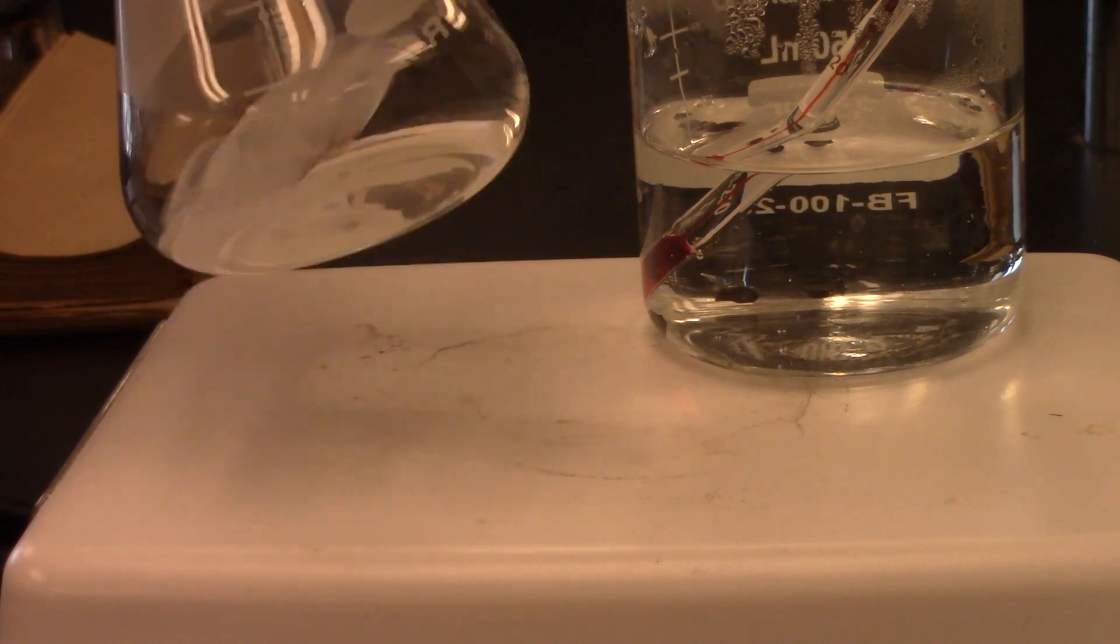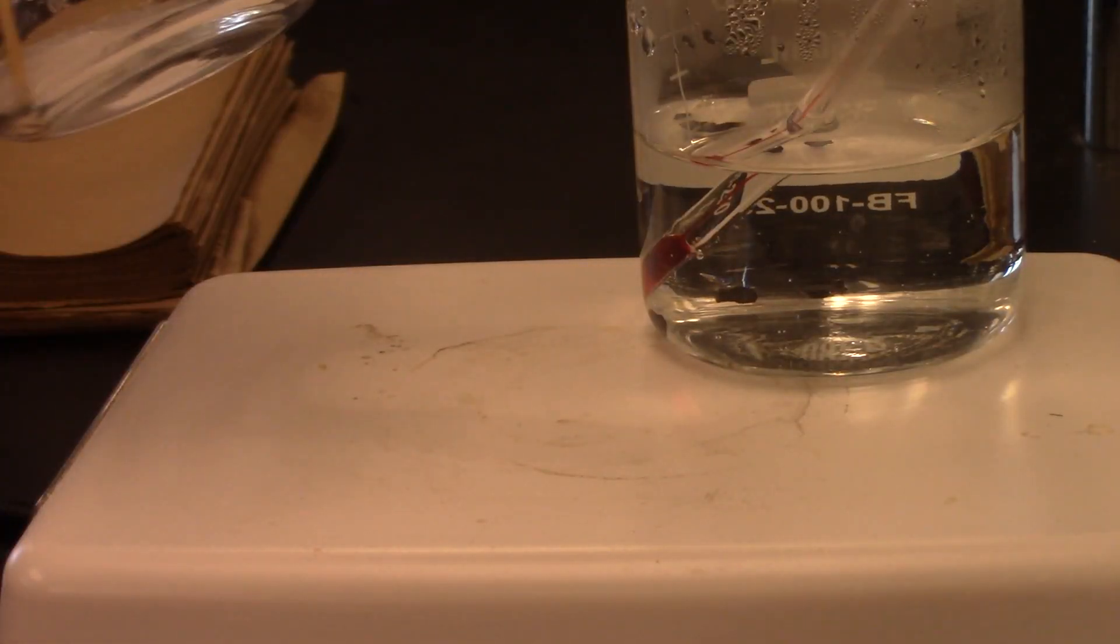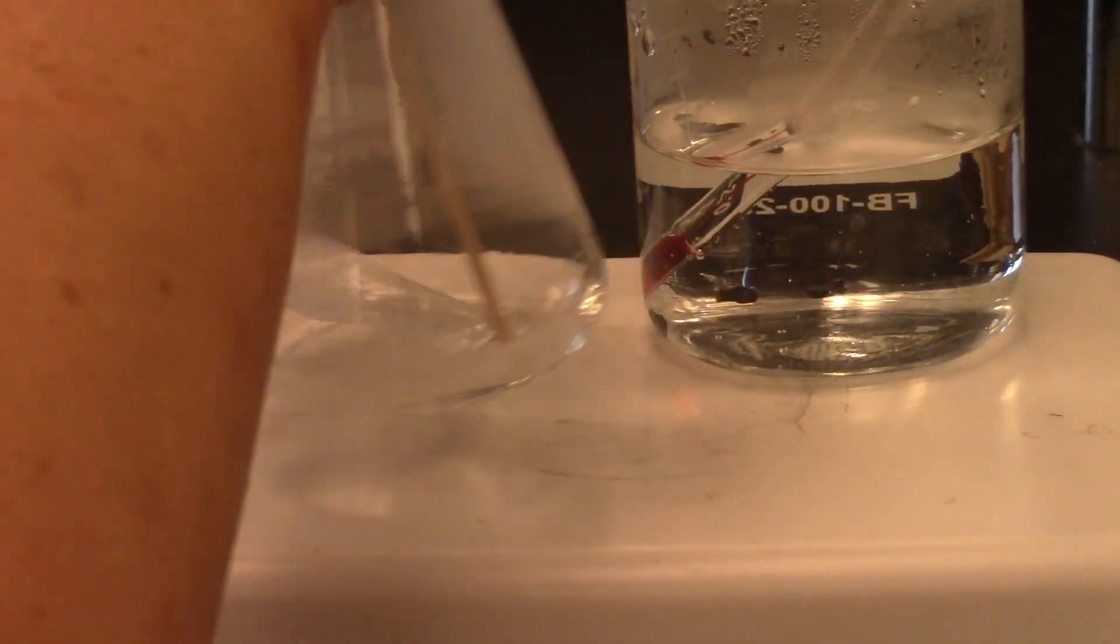Until all of the phthalic acid has dissolved. So there is still solid in there. I'm going to make sure that this does get up and stays hot, because again, the hotter I make it, the more is going to dissolve right now, which means when I cool it down, I will get a better recovery rate. So I'm just going to kind of keep going. Sorry if my arm gets in the way sometimes. It's kind of awkward to do this with the camera. This will switch to my left hand a little bit more.